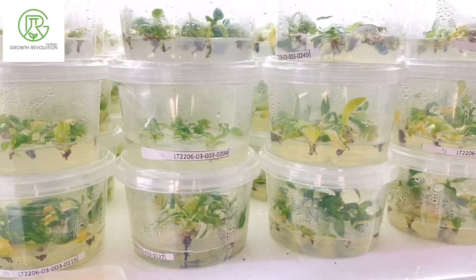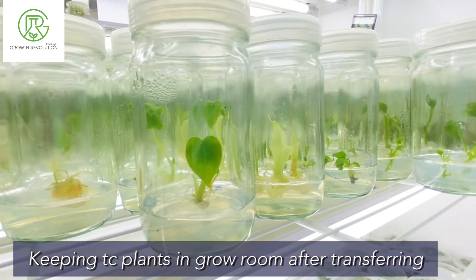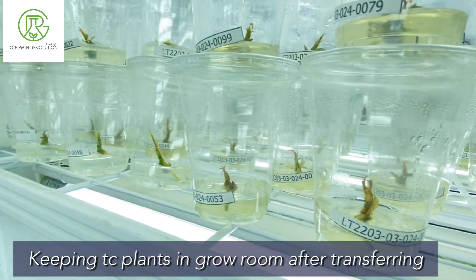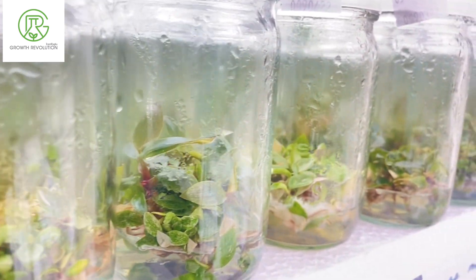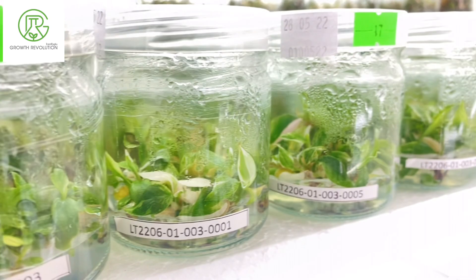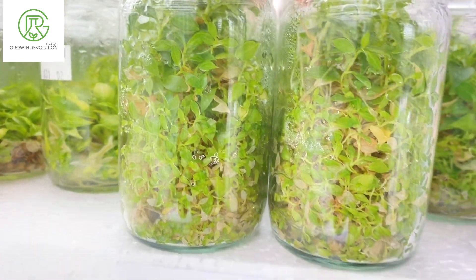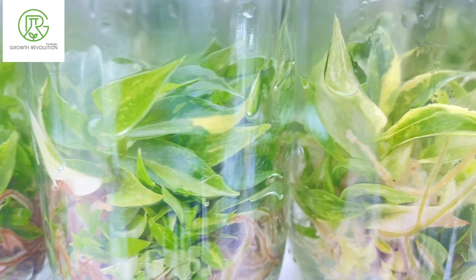After we finish our transferring process, we are going to take the TC plants that we just transferred to the new media into the grow room, where we can control the temperature and the light. You can see there are many different kinds of jars and each jar contains a different number of plants, because these are for different purposes — this one for the stock and this one for the rooting stage where we can separate or root them.